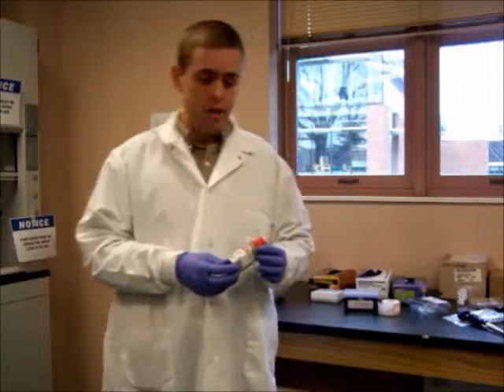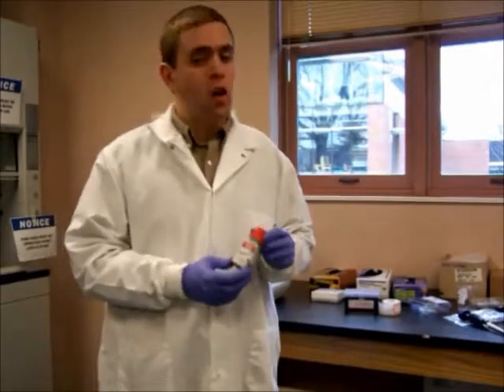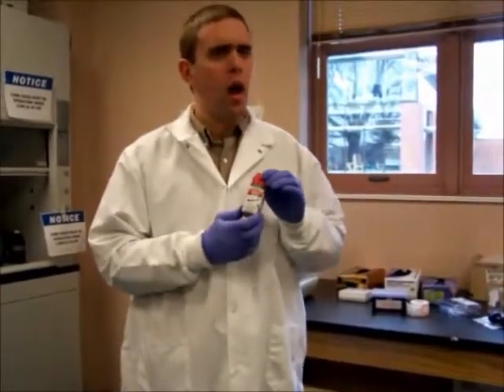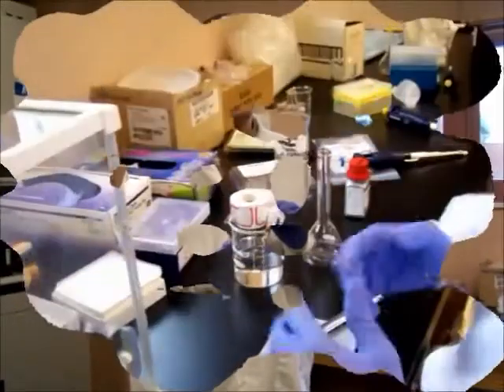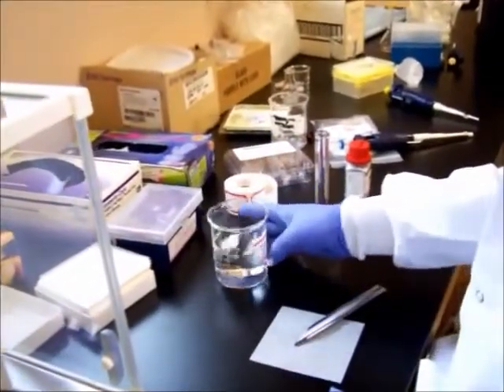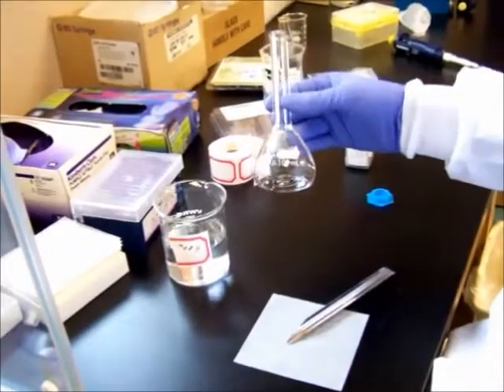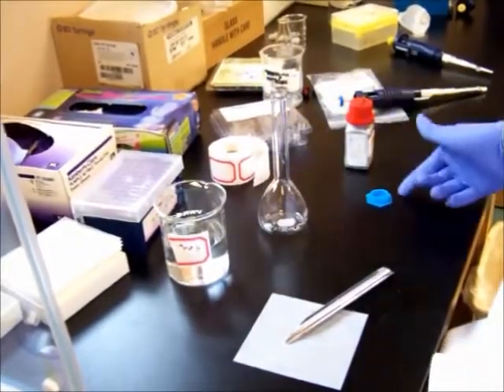For our demonstration today, we're going to be running a polyphenol through the instrument called Naringin. Before we run it, I'm going to show you how to prepare a sample of Naringin for running through the instrument. So we have our workstation ready. We have our methanol prepared. We have a 100 milliliter volumetric flask and its lid.